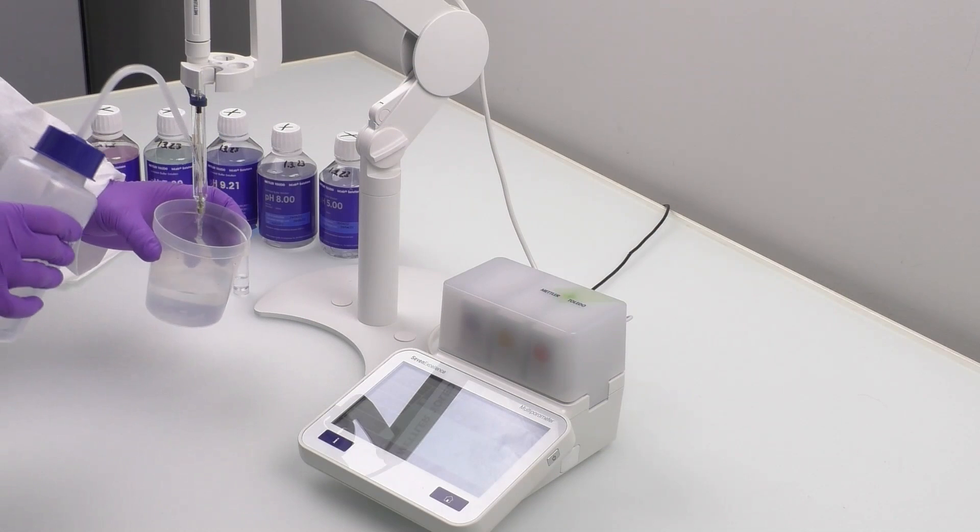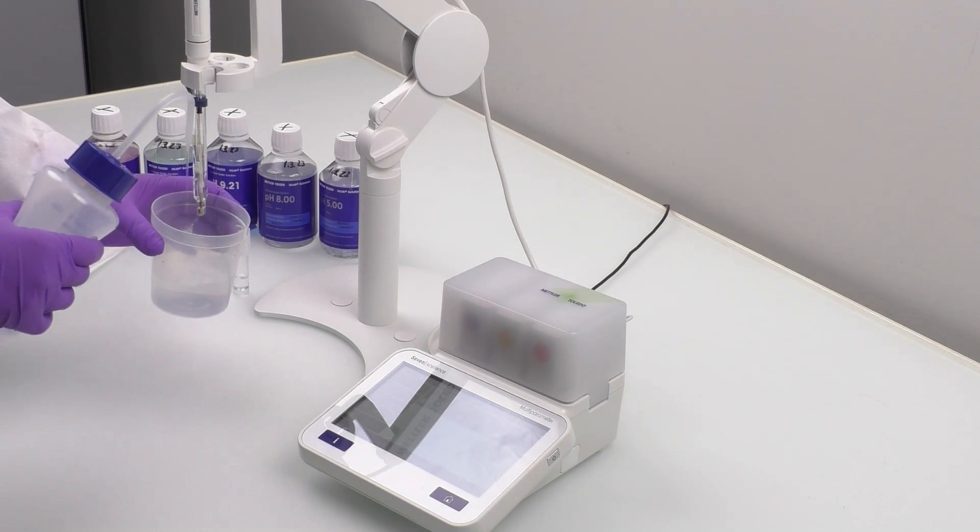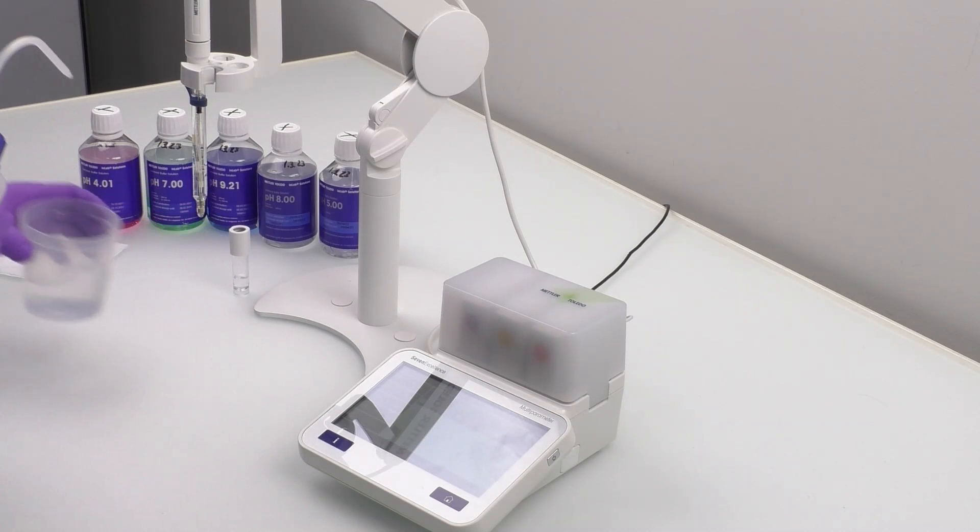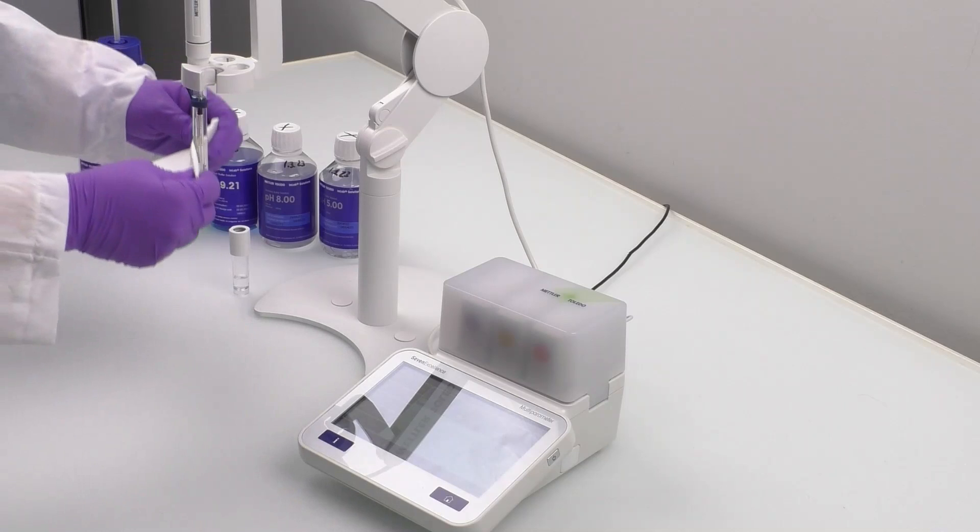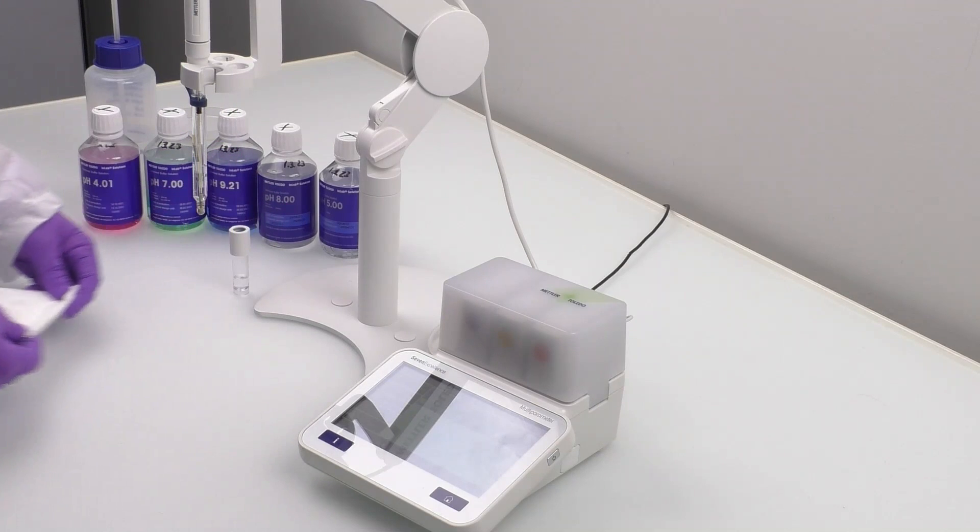After completing the verification process, rinse the sensor again and dab it dry with tissue. And now, your sensor is all set to measure the pH of your samples.